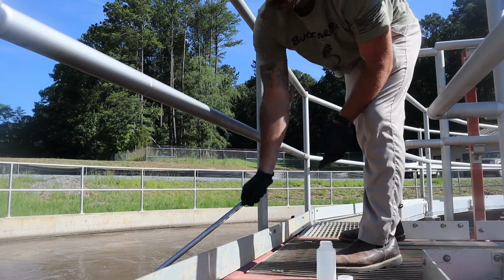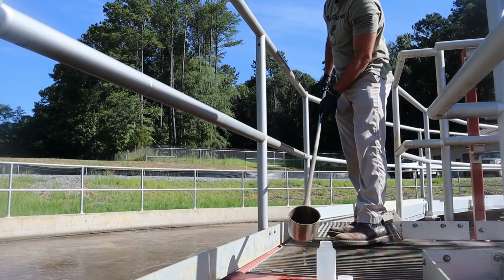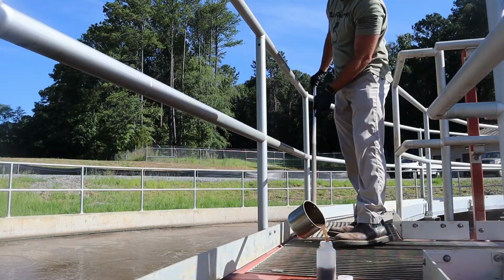Regarding manual sampling, you're going to use a sample stick. As you'll see here, we have a little bit fancier sample sticks. We ordered the nice fancy stainless steel ones. We got tired of the plastic ones getting brittle and breaking. For a lot of you out there, you're going to have these Frankenstein sample sticks, just this configured thing where you've taken a piece of bamboo and duct taped your water bottle to it, and that's what you're sampling with. Or you got a Gatorade bottle and a broken broom handle, and those two things are zip tied together, and that's what you're sampling with. Whatever your combination of sample stick may be, that's fine.